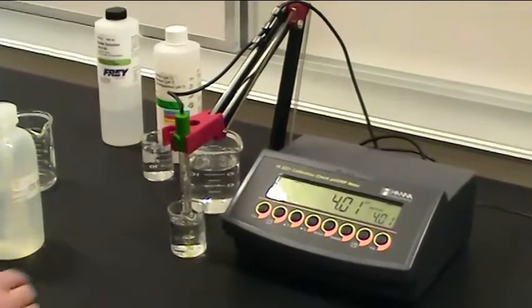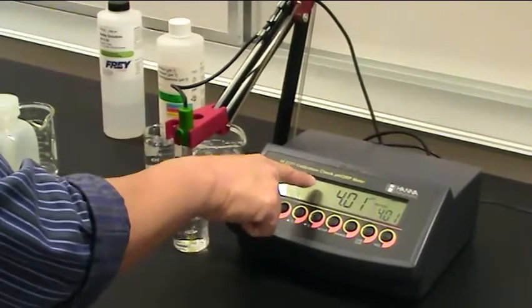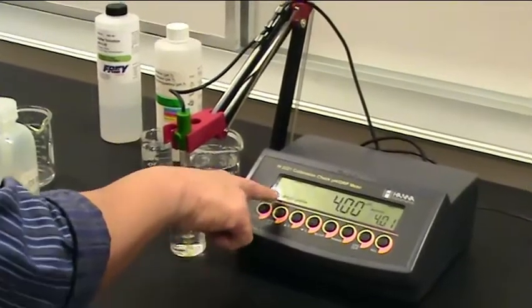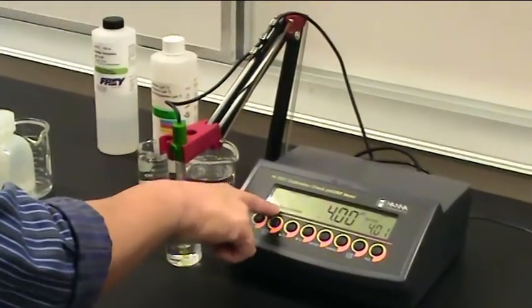And again, you'll see that the CFM will be flashing. And then you're going to hit the confirm button. Okay, so go ahead and confirm that.